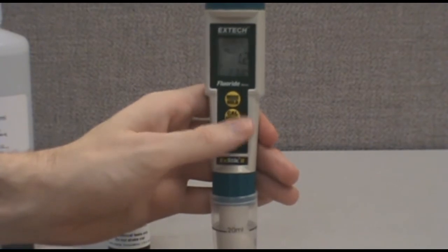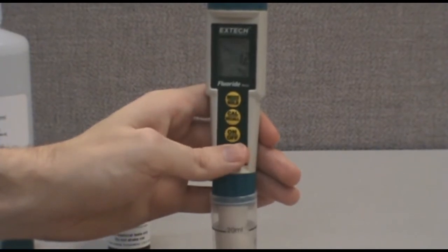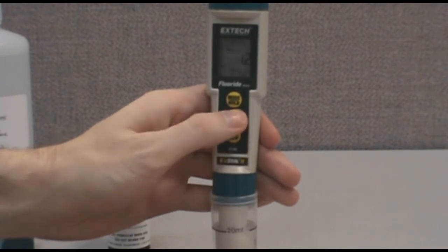Wait for the reading to stabilize. This will take approximately 35 seconds. Press and hold the Cal key. The display will cycle through the calibration values.